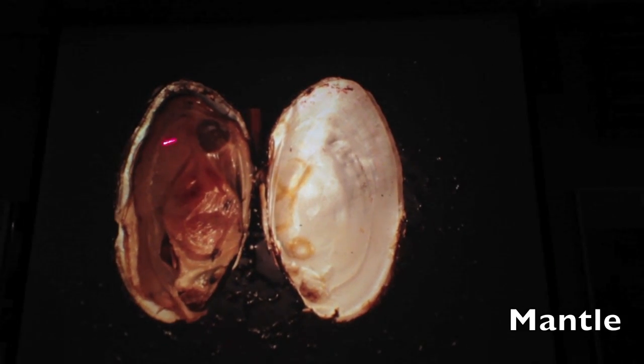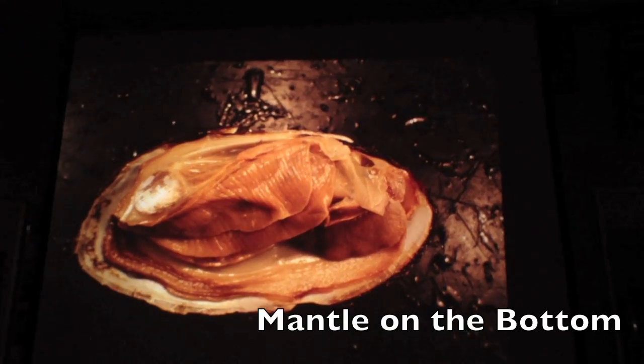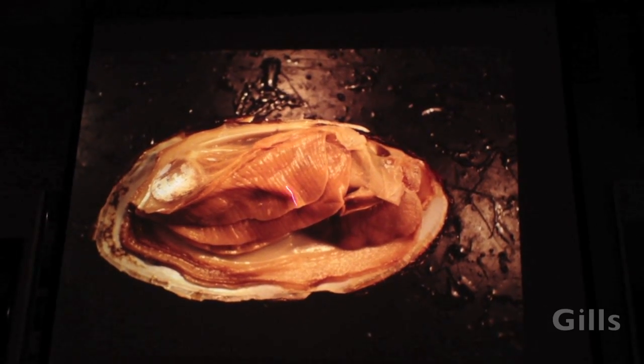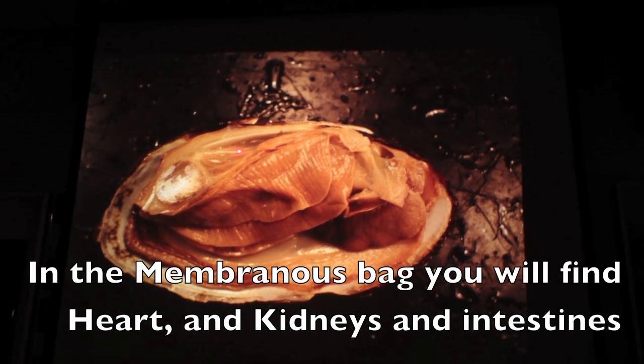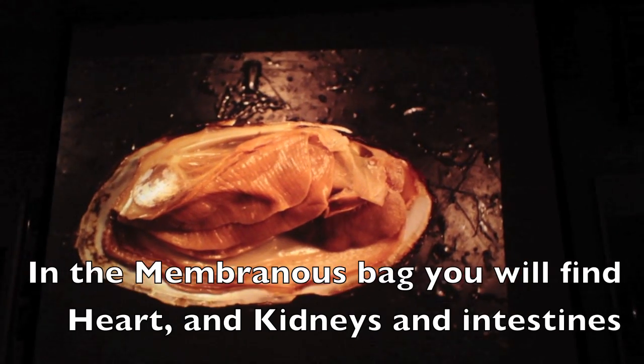Easy one. What's this layer of tissue here? Mantle. Now this is with the mantle taken off, so you still got mantle down here. What's this thing right here? Foot. That's the foot. What are these? Gills. What are you going to find up in this membranous bag right here? Heart and kidney and intestine run through there as well.